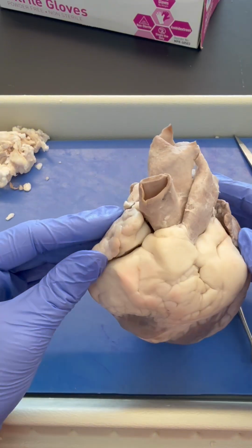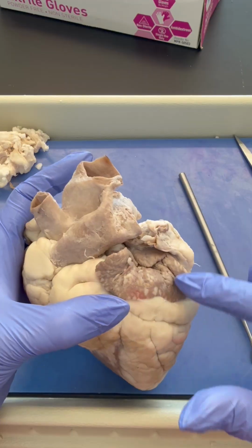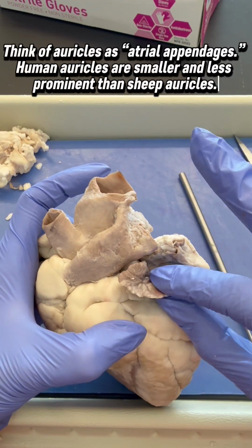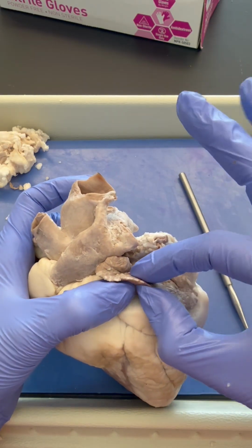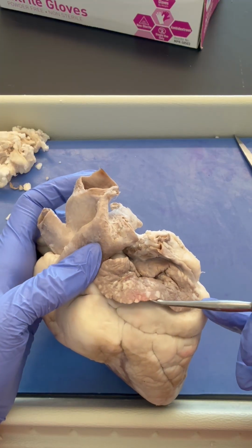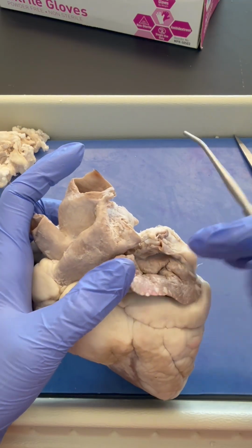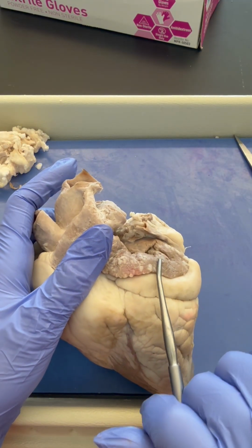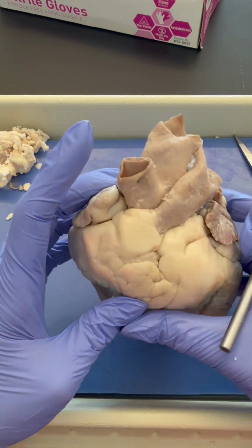So we found the ventricles. The next thing to find are the atria. If this was the left ventricle, this would be our left atria. The auricle is this ear-shaped extension of the atria. It essentially is the atria. You can think of the auricle like the rim of the atria. So the atria is very, very small. This is the collecting chamber. It doesn't pump blood. Notice it doesn't have this thick cardiac muscle. It's just receiving blood. And then the volume of the blood itself is letting the valve open so that blood can fall into a pumping ventricle.